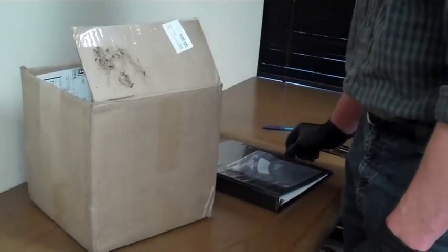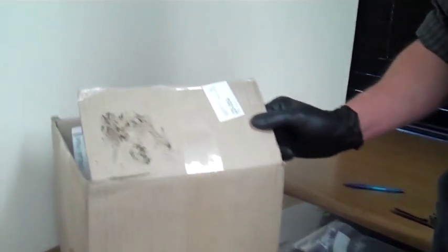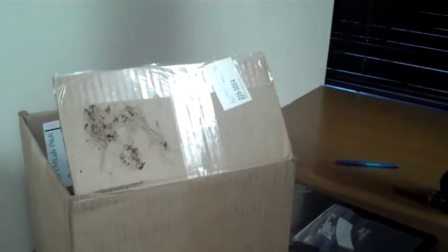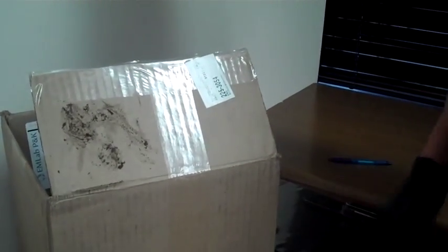The last type of sample we will be collecting today is a bulk sample. Of all the methods we have shown you today, bulk sampling is the preferred method.